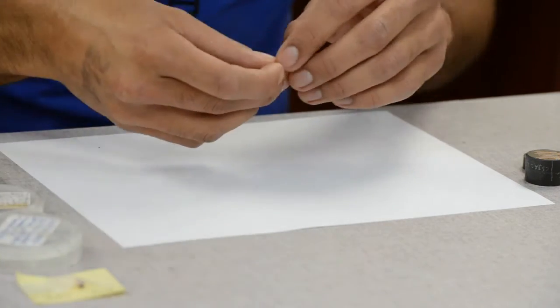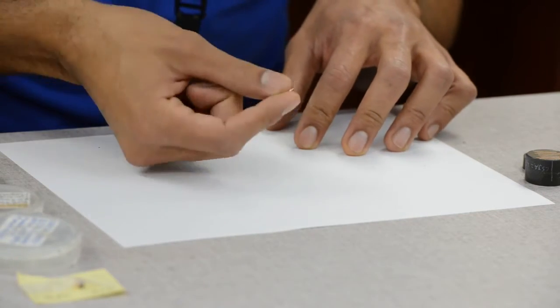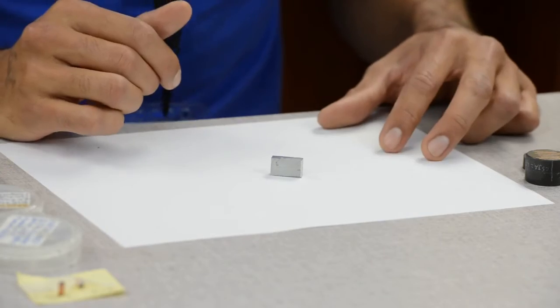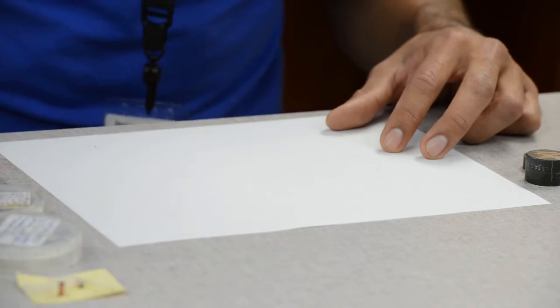We also have these thicker samples — I also want them in a transverse cross-section. These are quarter sections of wires. And finally, we just have an aluminum block. I want to show you guys what aluminum would look like inside a puck once polished.